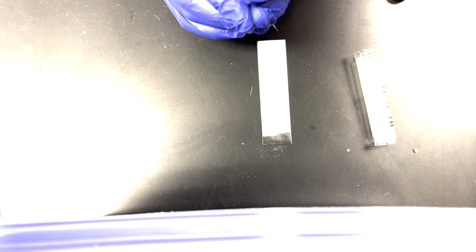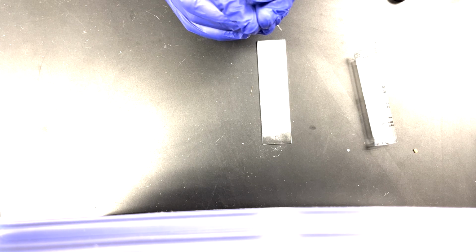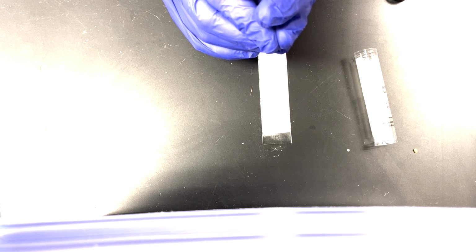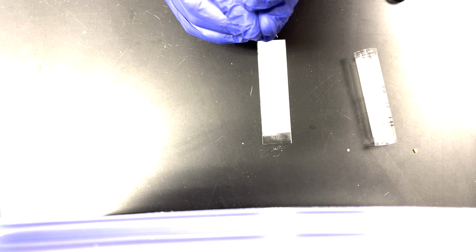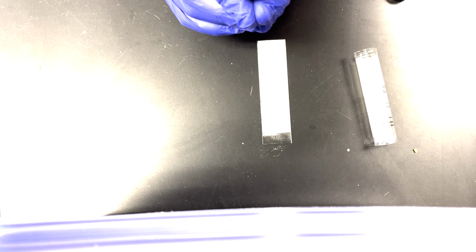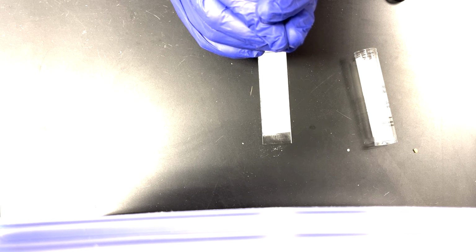And if you don't see results, one of the first things that we're going to consider is, did I spot enough material? So a small spot with a good amount of material is what you're hoping for. It can be a little frustrating, and it can take a little bit of time, but have patience. Keep your spot ideally 1 millimeter or so, maybe up to 2 millimeters. You should be able to pretty easily fit 3 spots that aren't anywhere near touching each other on these narrow plates. And if you're very careful, sometimes you can get 4 spots.